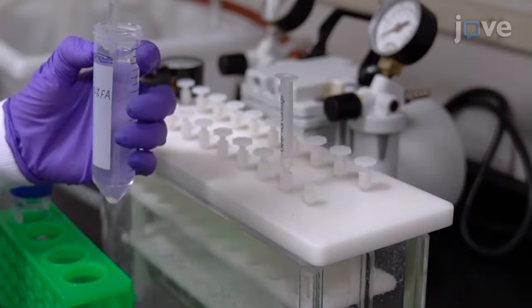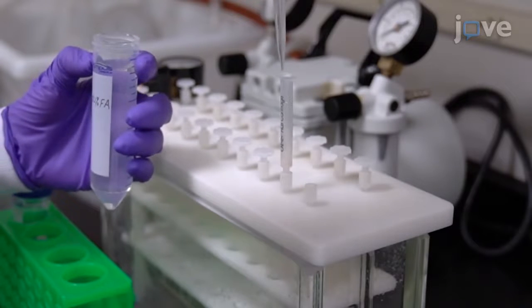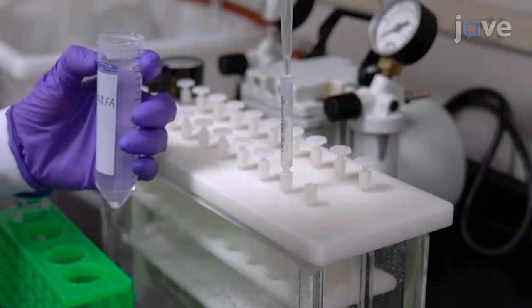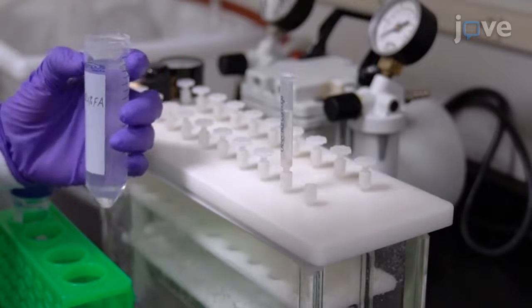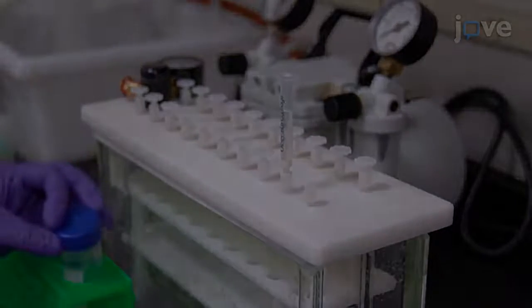Equilibrate the cartridges by adding 800 microliters of 0.2% formic acid in water with vacuum suction. Repeat this twice.